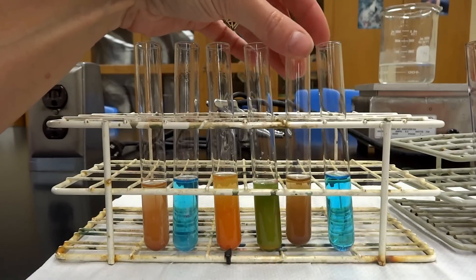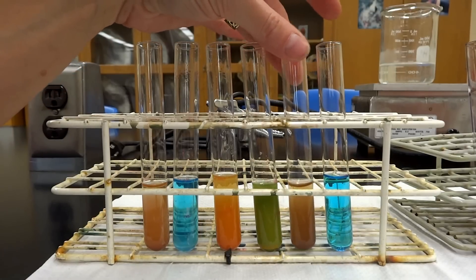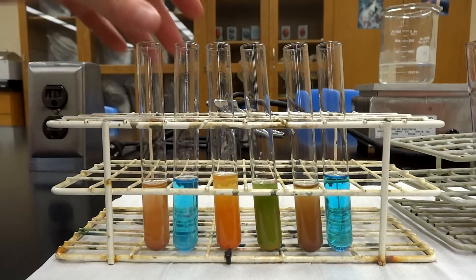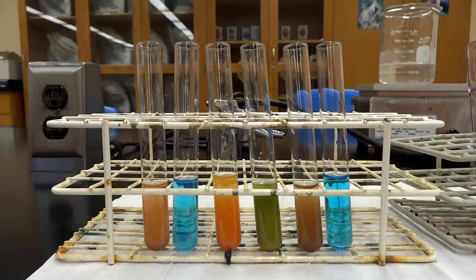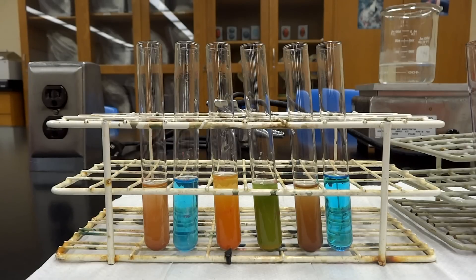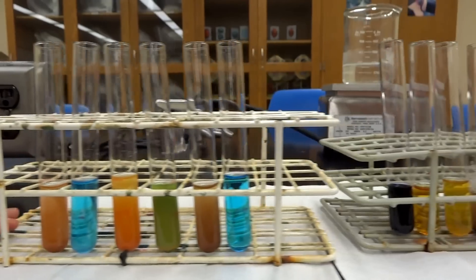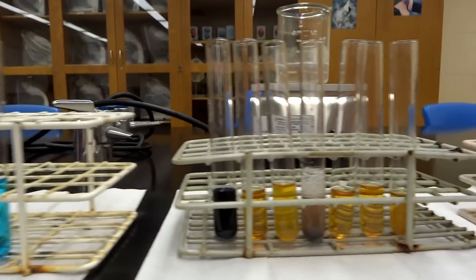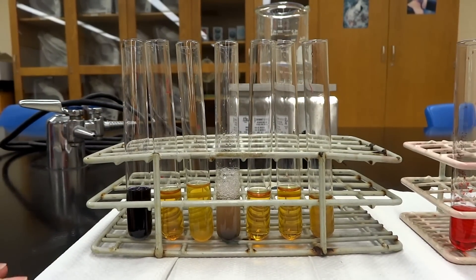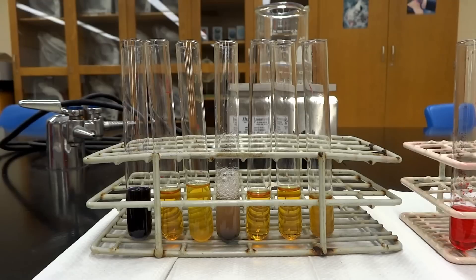Number five is glucose — remember glucose is a reducing sugar — so it is also going to test high for reducing sugars. The last one is starch: since starch is a complex carb, it is not going to test well for reducing sugars.